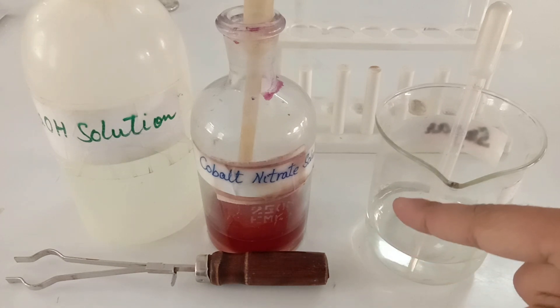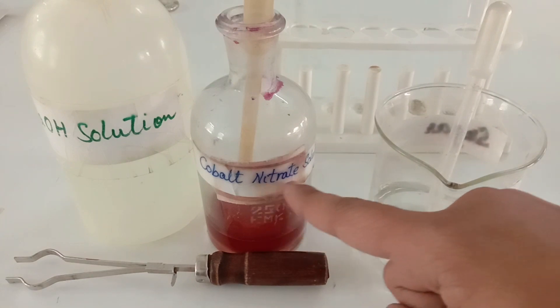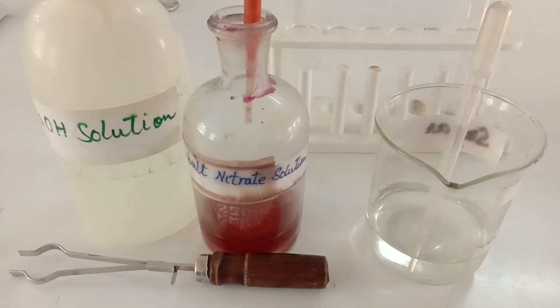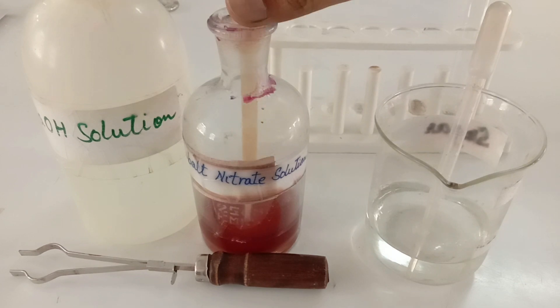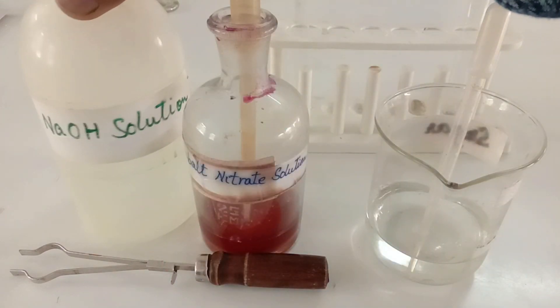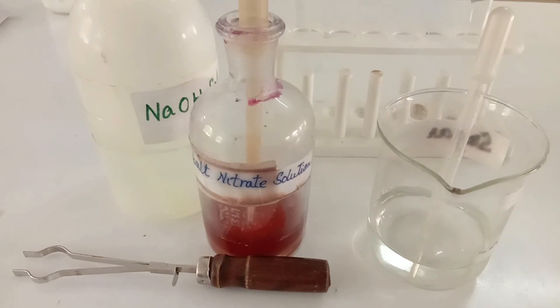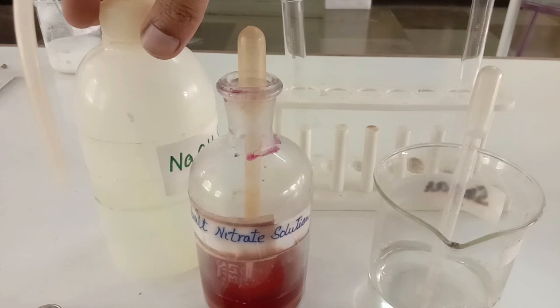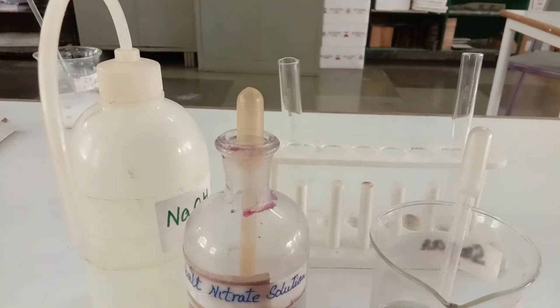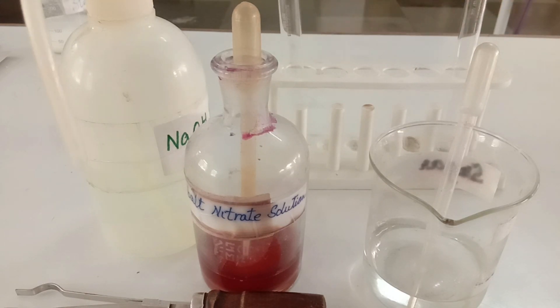For this experiment we require some amount of food solution, which I have taken in a beaker; cobalt nitrate solution, which is orange in color; a dropper; a test tube holder; sodium hydroxide solution, which is kept in a plastic bottle with a nozzle to pull out the solution very easily; test tubes; and a test tube stand.